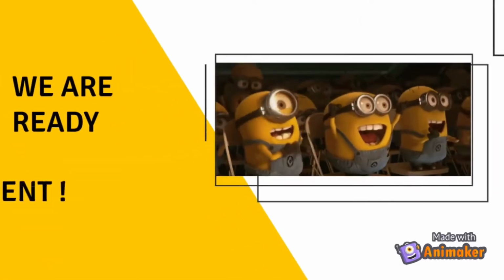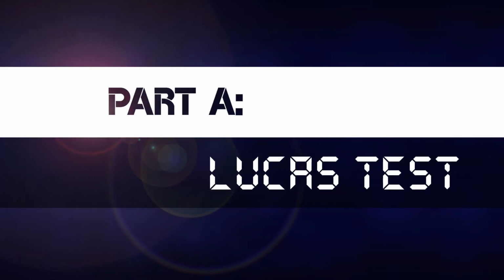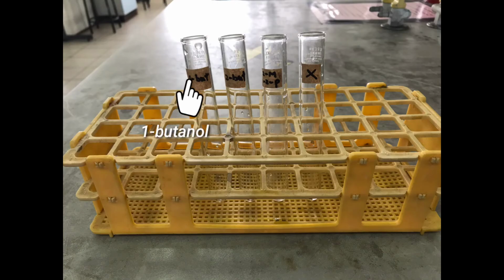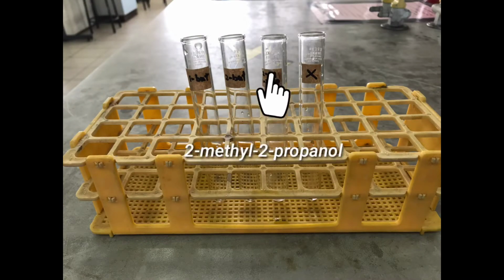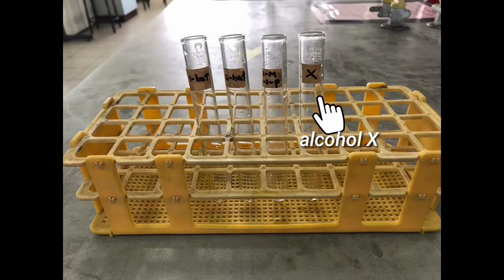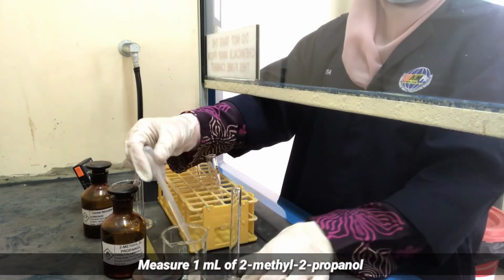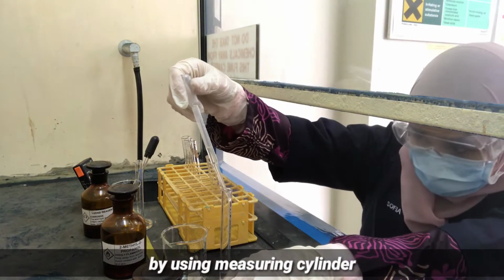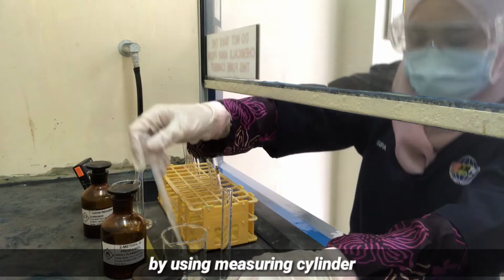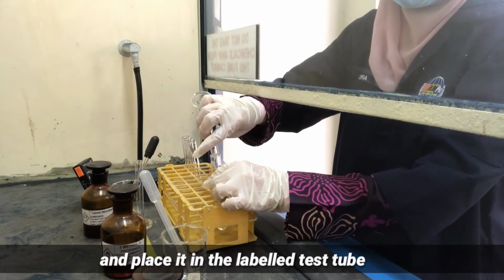Now, we are ready for the experiment. Lucas test. Label 4 test tubes as shown. Measure 1 ml of 2-methyl-2-propanol by using a measuring cylinder. Fill it in the labeled test tube.